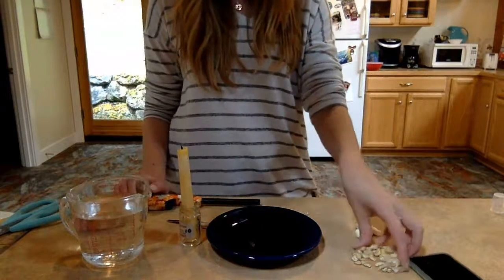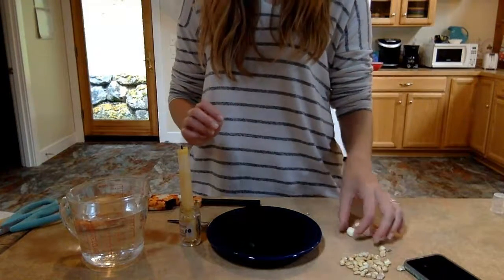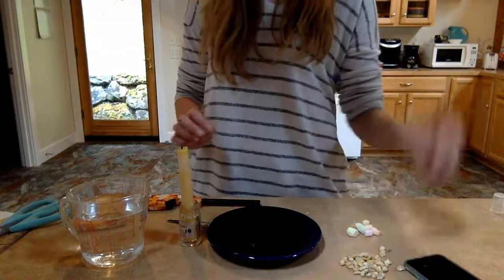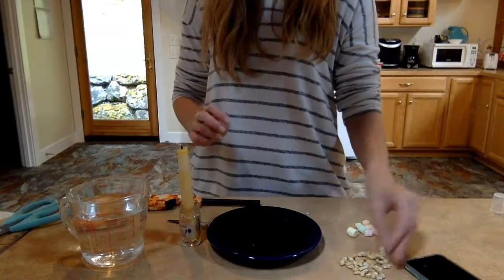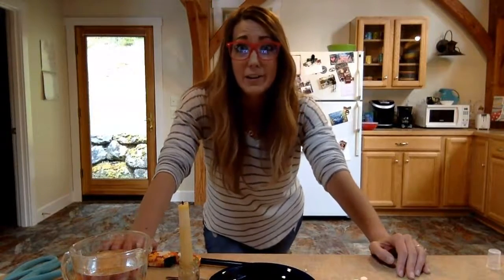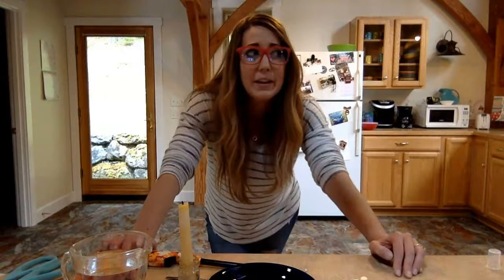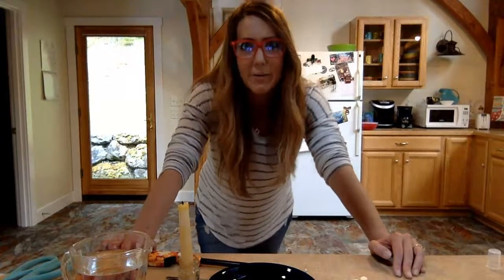And then I have the things that I'm going to be setting on fire. So I've got marshmallow. I have peanut that I dug out of my trail mix. I have raw cashews from my freezer. And you are also then going to pick one item from your pantry to set on fire. It could be a cracker, it could be a piece of cereal, it could be a raisin, whatever floats your boat.